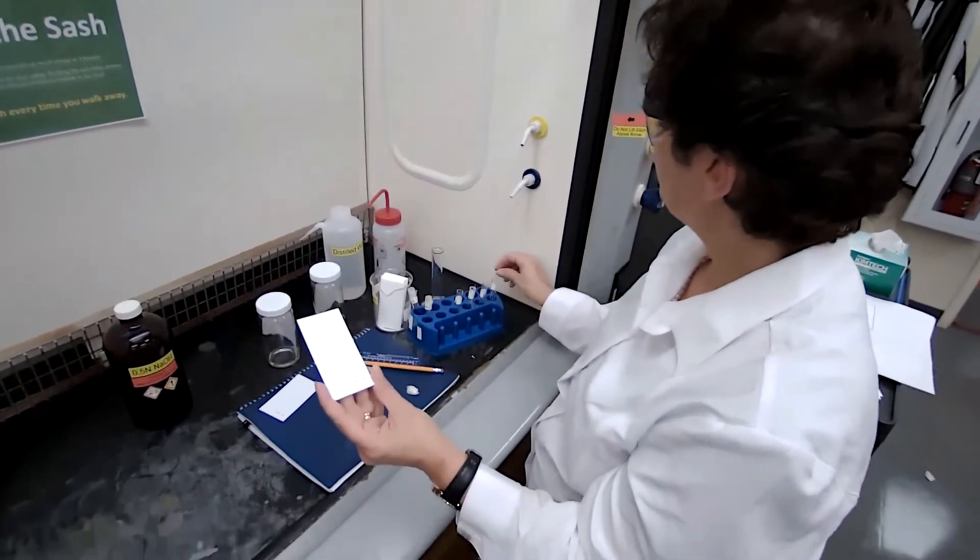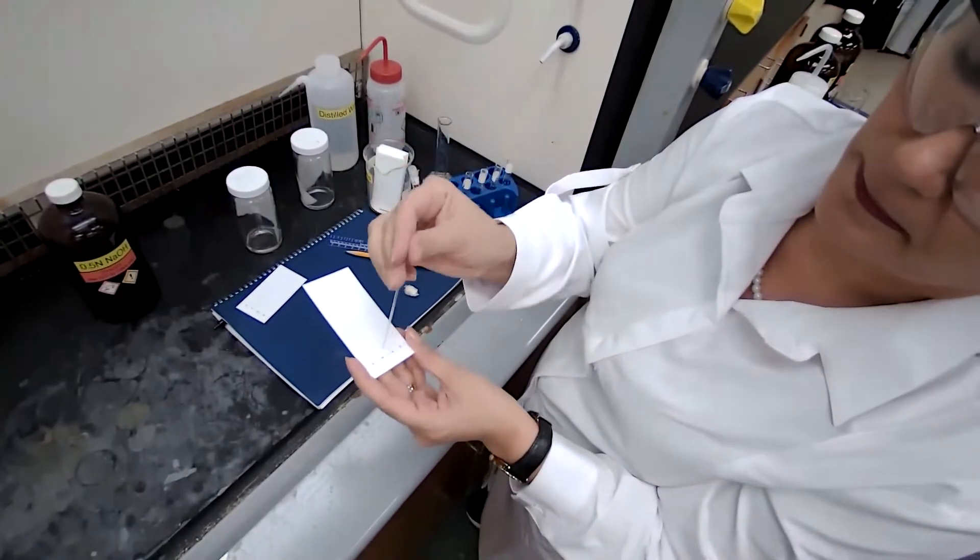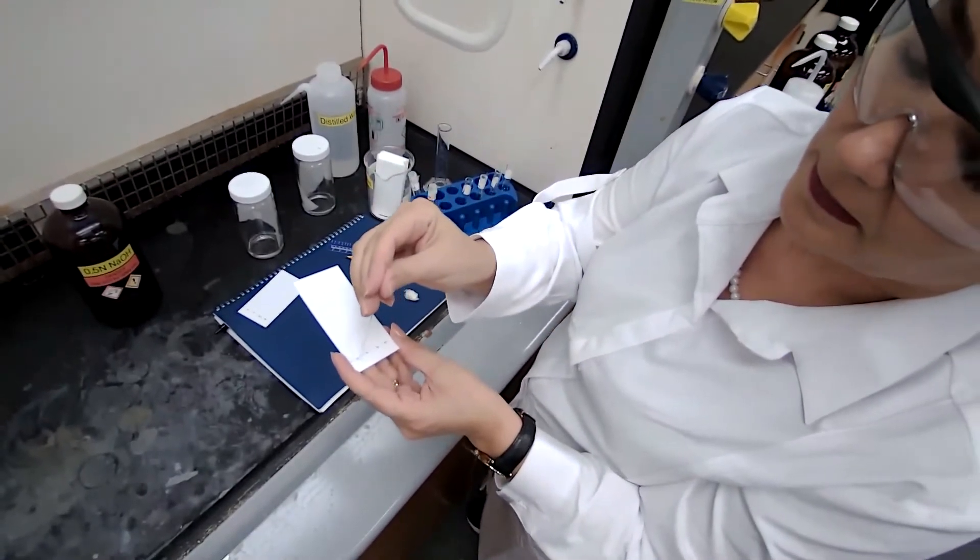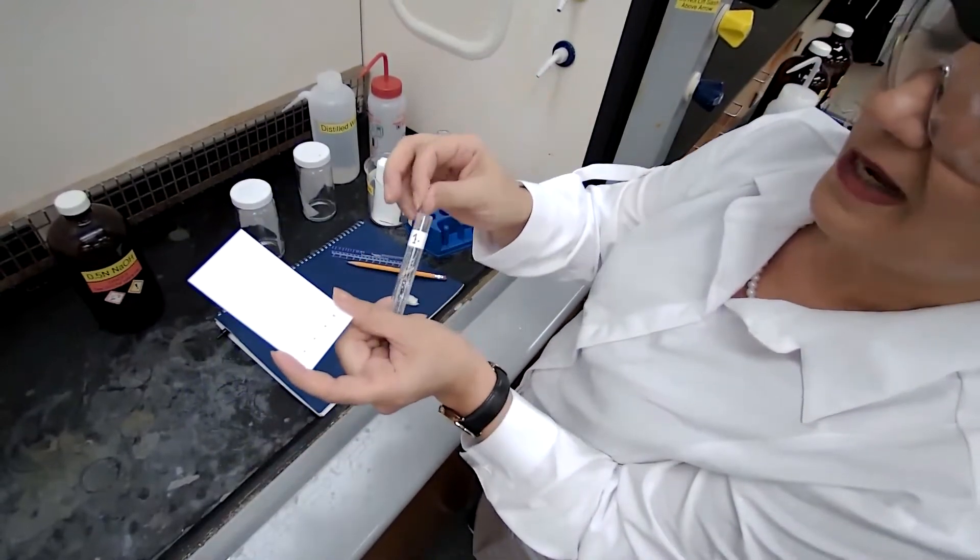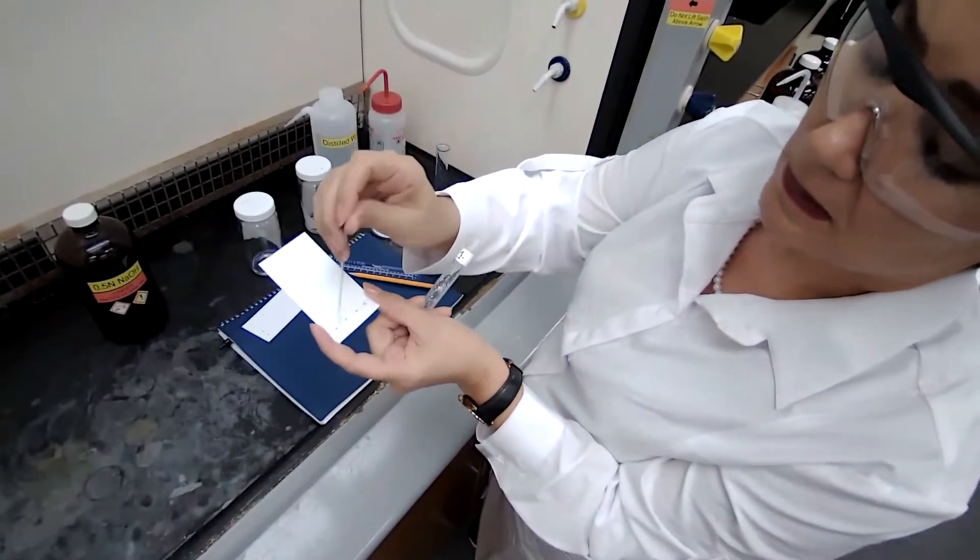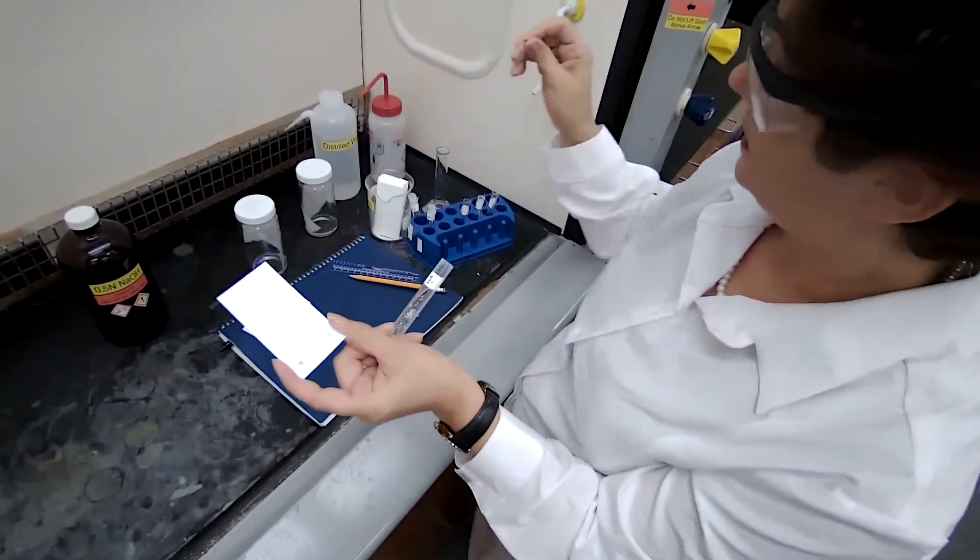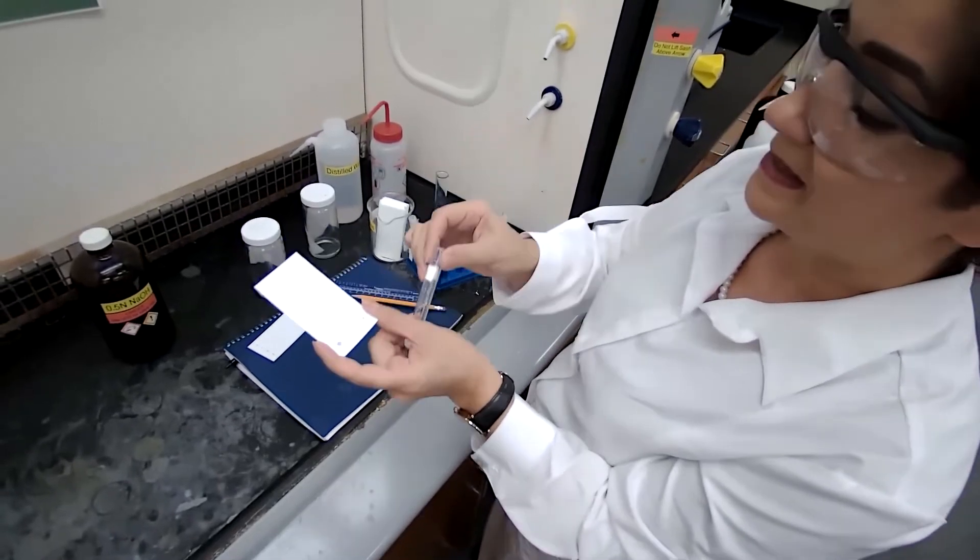I will also prepare my second sample which is identical to the first one, just repeating for a second trial. I don't need both samples, whichever comes out better I will use for my data analysis. Okay, one: acetaminophen.